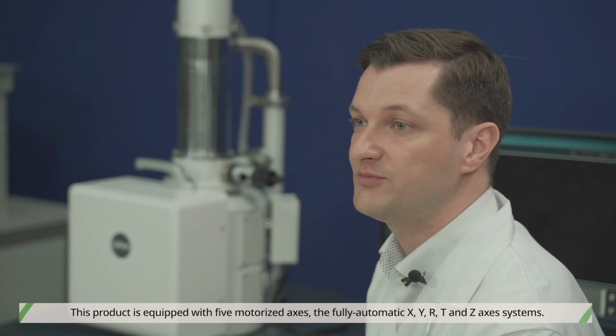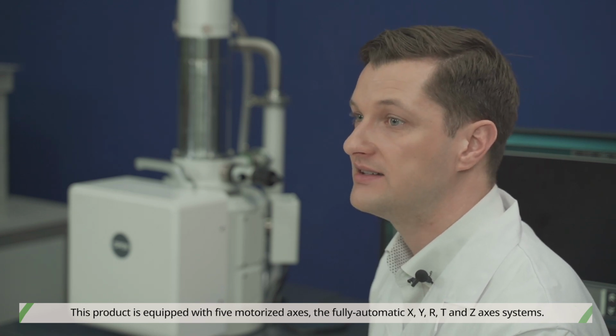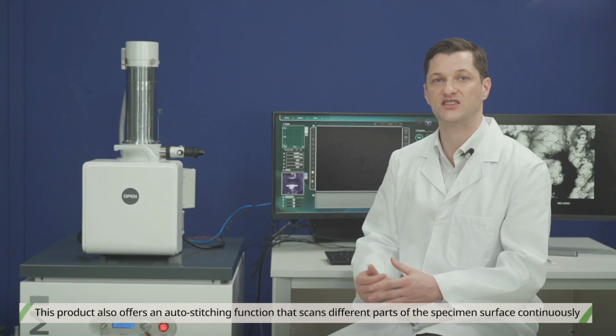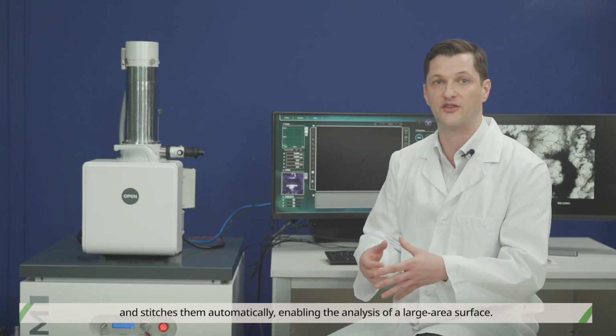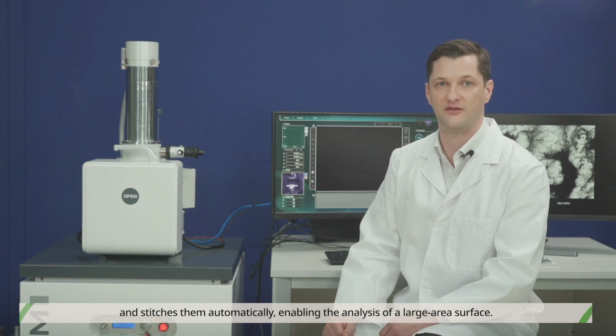This product is equipped with 5 motorized axes, the fully automatic X, Y, R, T, and Z axis systems. This product also offers an auto-stitching function that scans different parts of the specimen surface continuously and stitches them together automatically, enabling the analysis of a large surface area. For more detailed specifications of the products, please refer to the company website below.